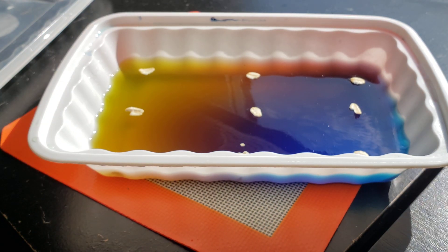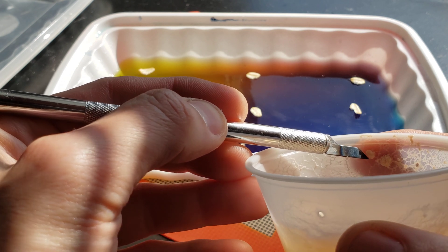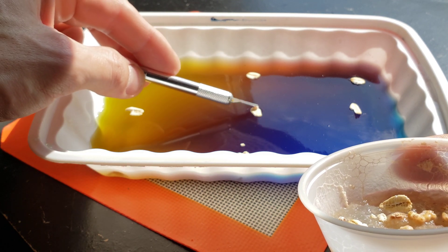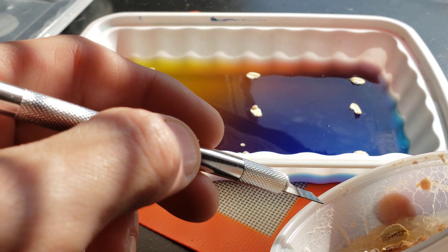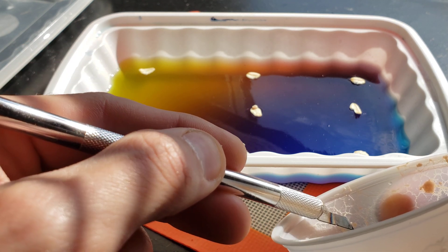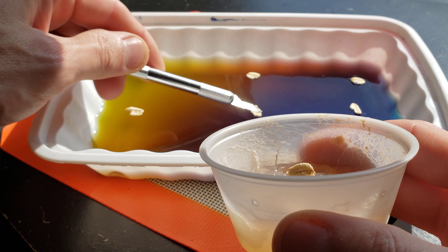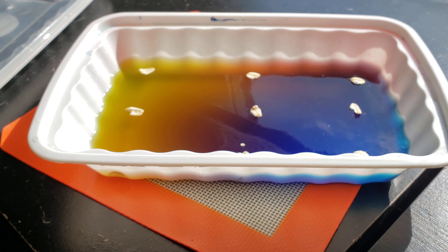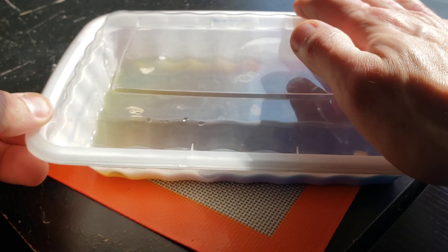Let me go ahead and move a piece into there — I'll get a bigger piece here and put it right in the center on the oatmeal. Then I'll take another little piece and put it on the bottom part. Today's July 4th, I'll go ahead and mark that.